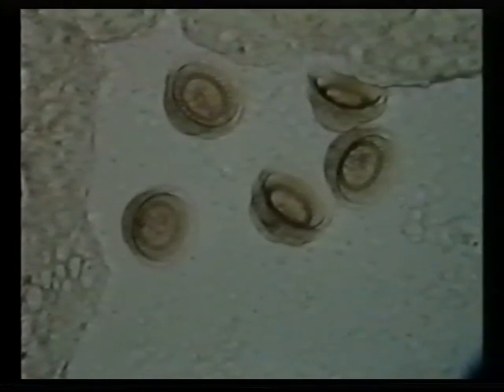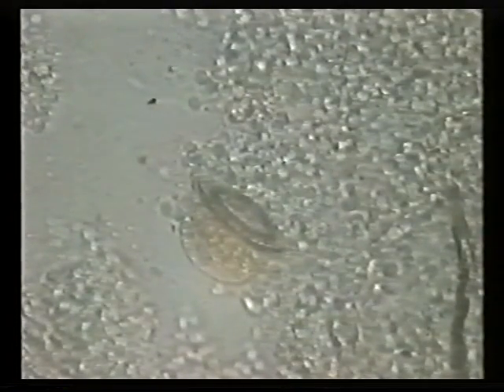Their main traction, without a doubt, is assisted by a ring of fine hairs totally surrounding their body. Beating these profusely propels them through the water. This ring of hairs is termed the ciliary girdle. Trichodina reproduce by both binary fission and conjugation, binary fission being more common.